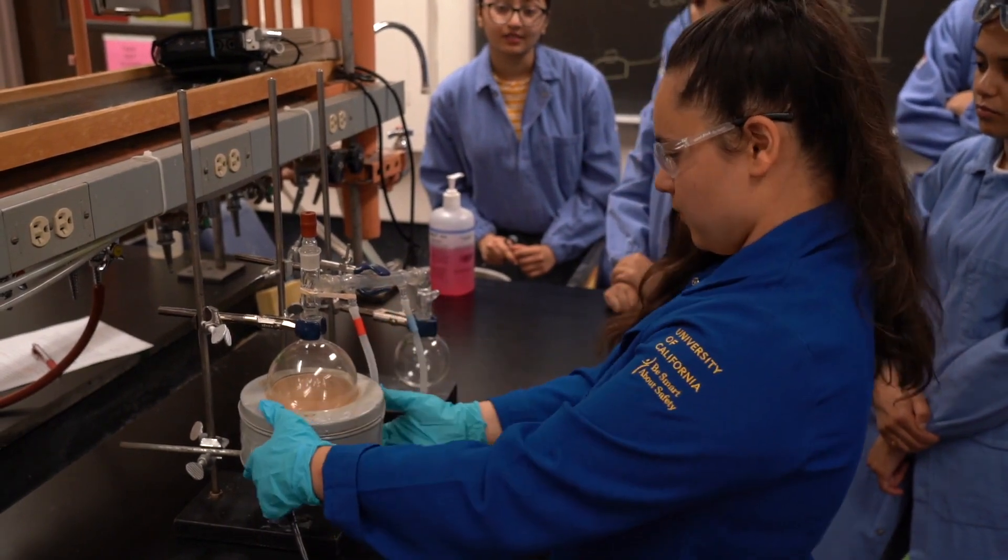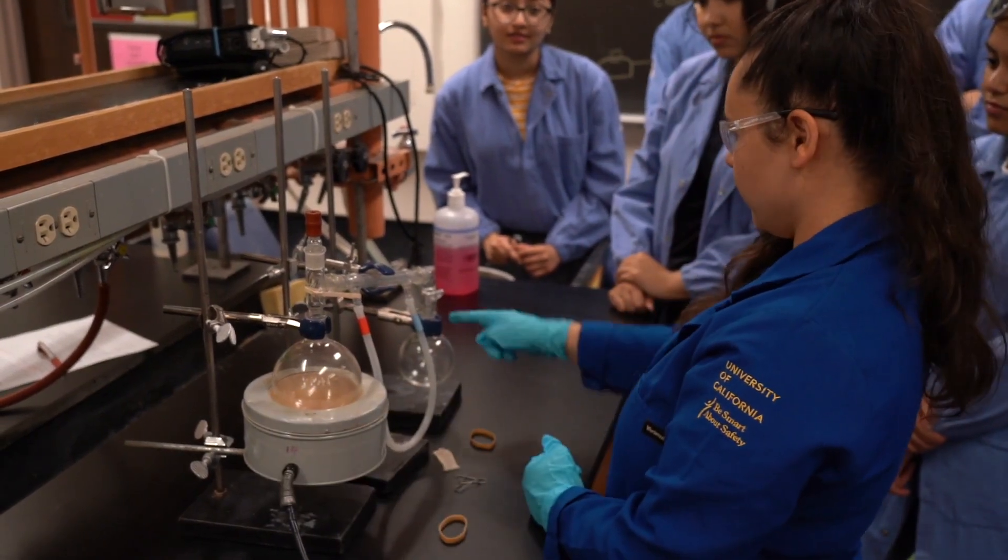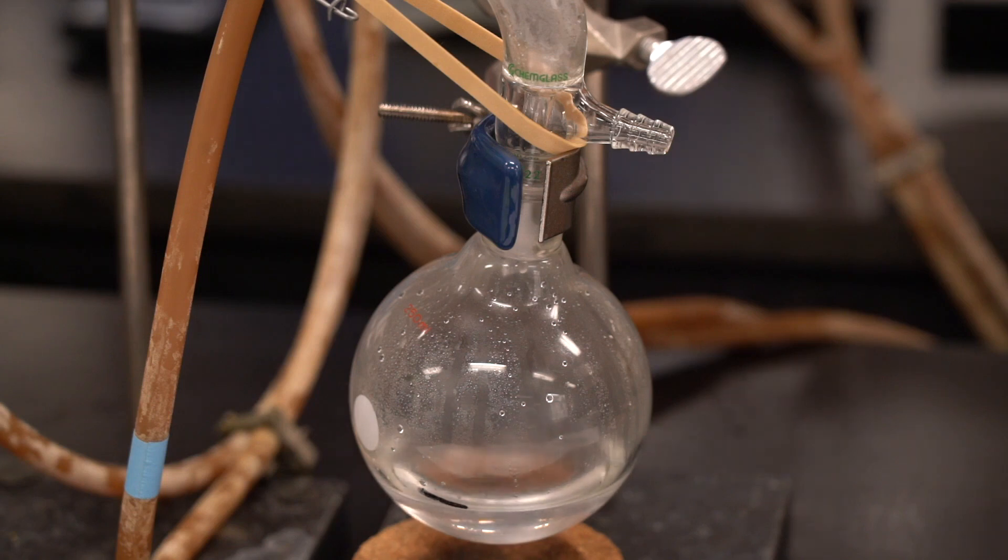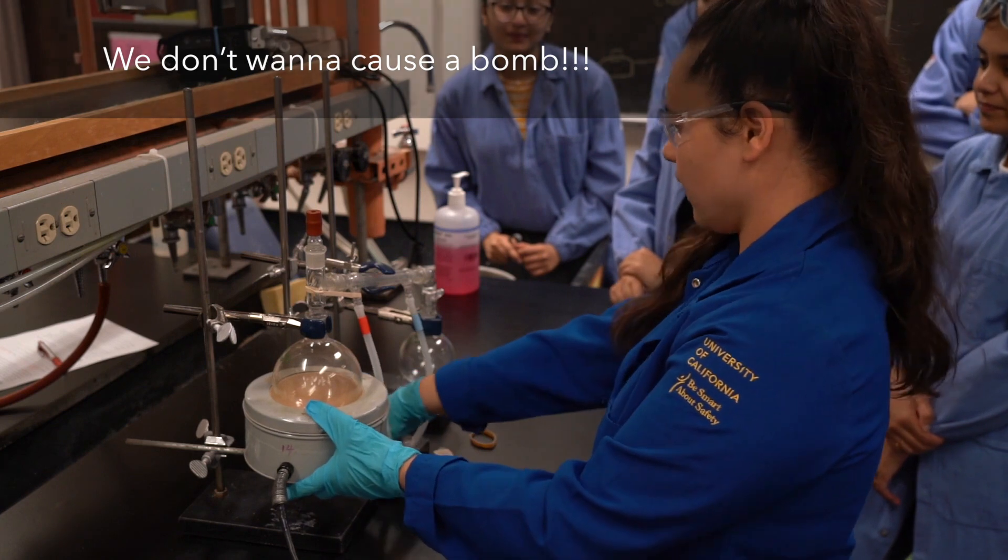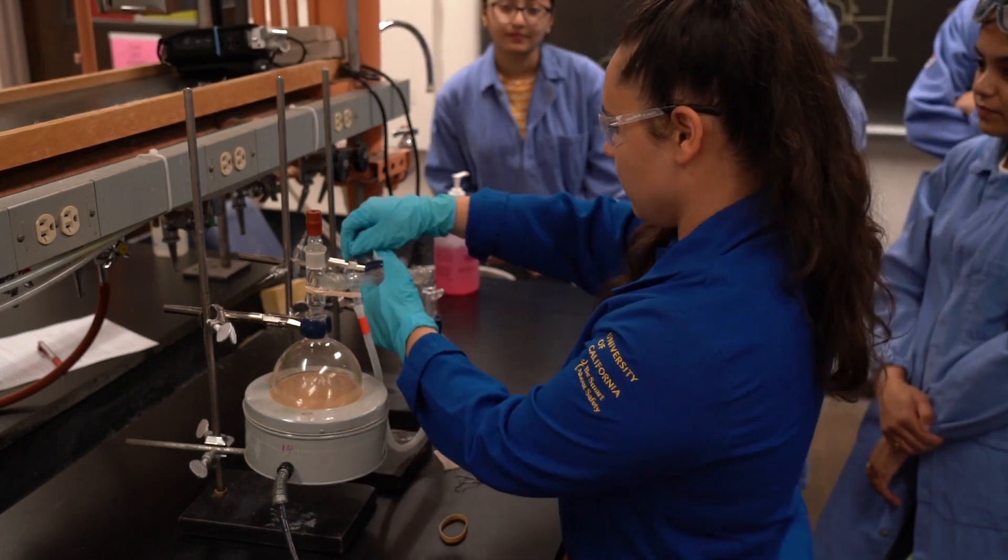How does it look, everyone? Did I do it right? Why is that left open? Pressure. You don't want to cause a bomb. Exactly. Any questions about how I set this up?